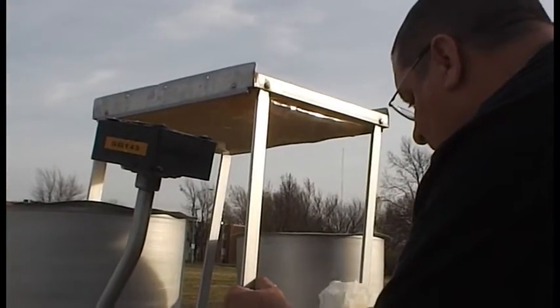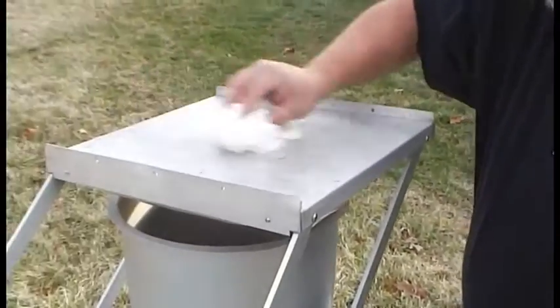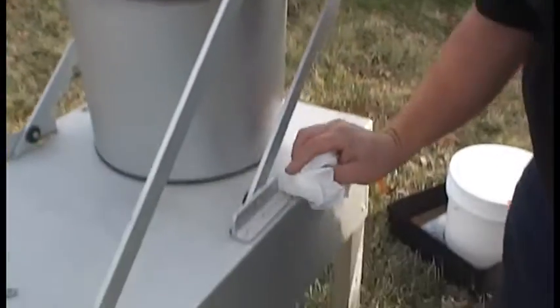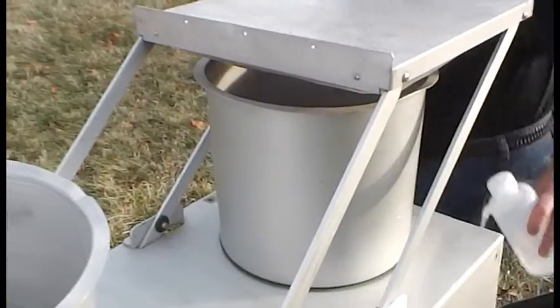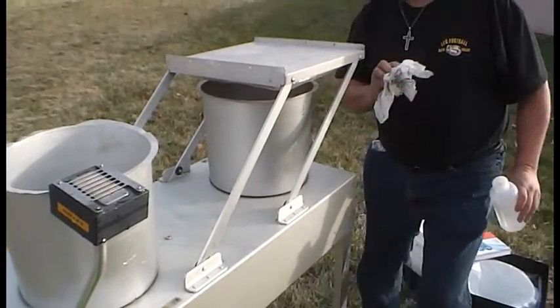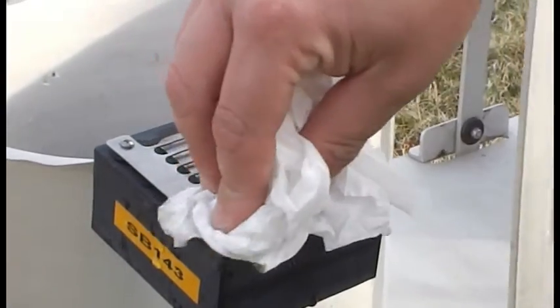Stopping the collector halfway open will allow you to thoroughly clean the collector arms as well as the underside of the lid seal. Be sure to note the condition of the lid seal pad and record any problems for Block 10, Remarks. Once this is complete, allow the collector to continue its cycle. You will also need to wipe down the entire collector, including the lid, body, and lid arms, as demonstrated here. If you notice that a replacement lid seal or other supplies are needed, call the CAL and make a note on your field form in Block 9, Supplies. Don't forget to remove any remaining debris or spider webs from the sensor and sensor grid.